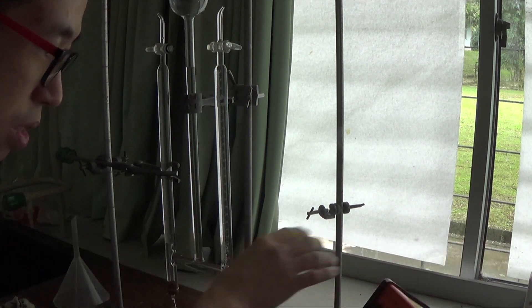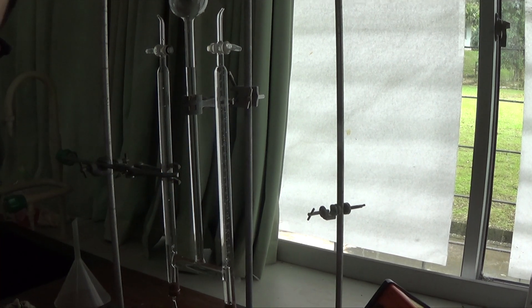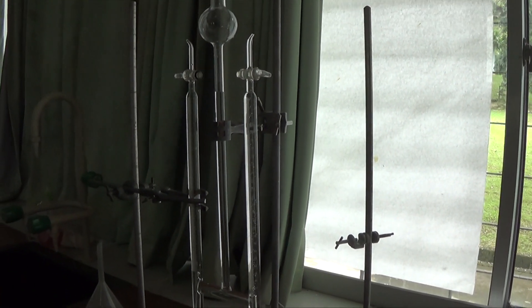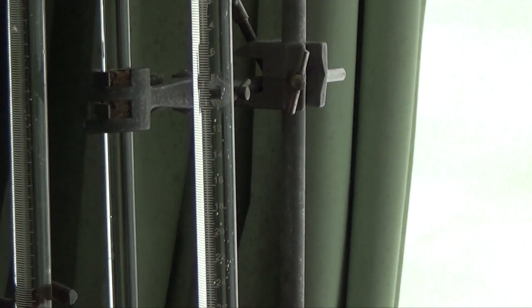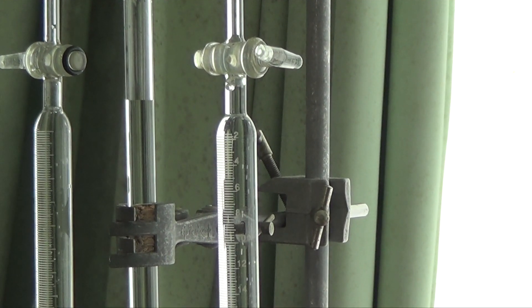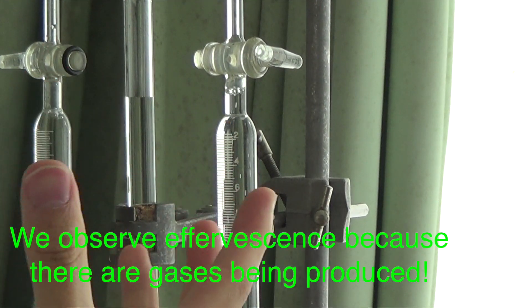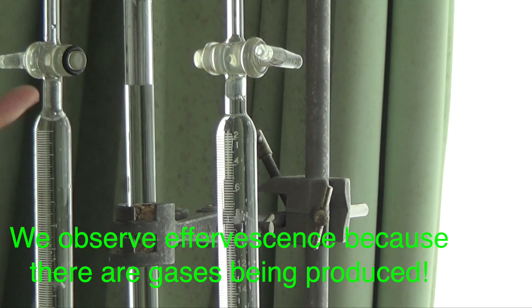I'm just going to turn on the power. And as you can see, if I zoom in a little bit, you could hopefully see some bubbling. There are bubbles because you get gases being formed. As soon as I turn on the power, the bubbles are being produced.